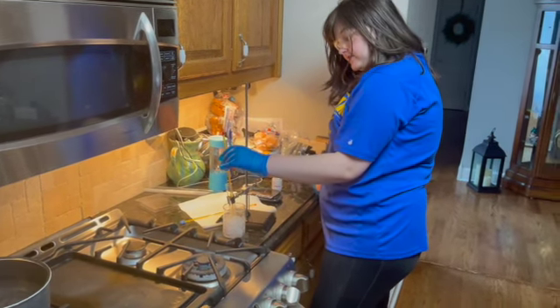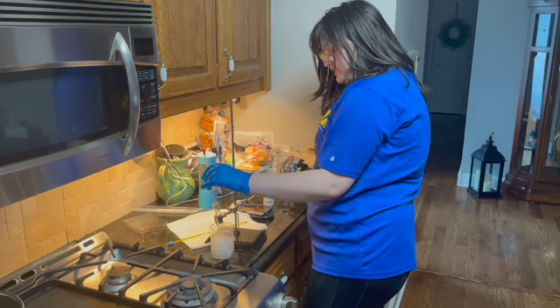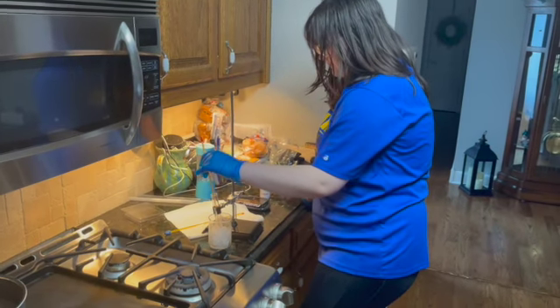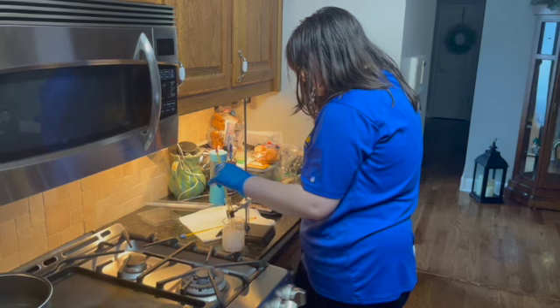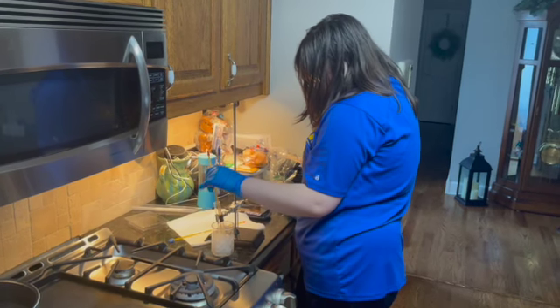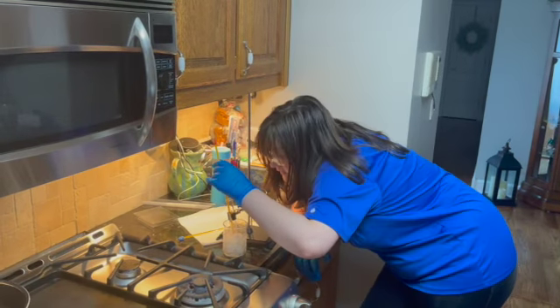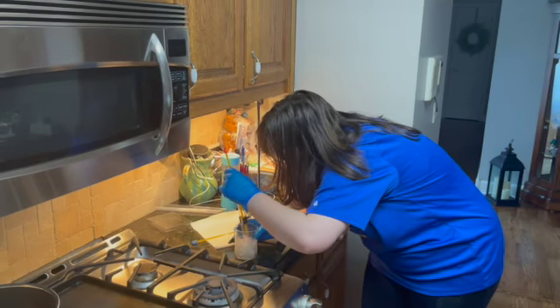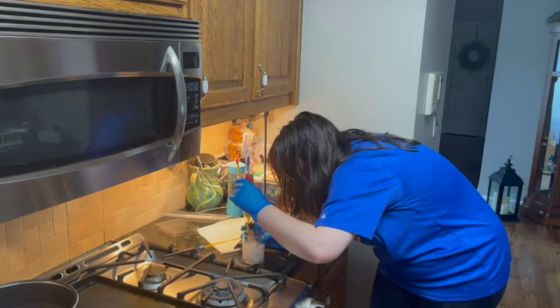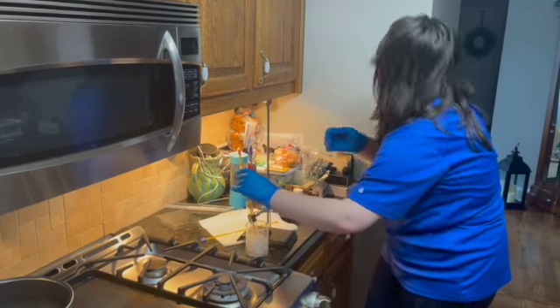I believe, just trying to remember, this is actually taking a longer time than it took for the paradichlorobenzene by itself to freeze over. So, let's see. Take a closer look at this, make sure. Okay, so we're reaching the 6-minute mark, and our solution is at 28 degrees Celsius.